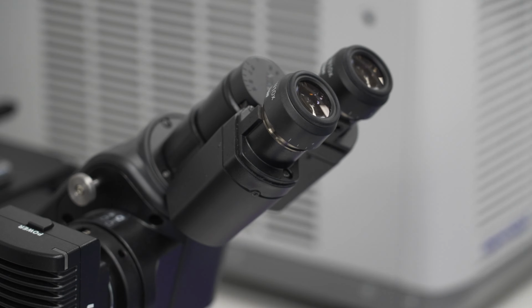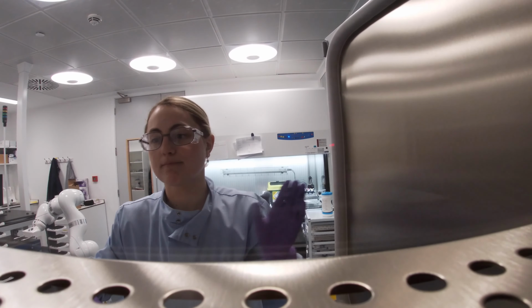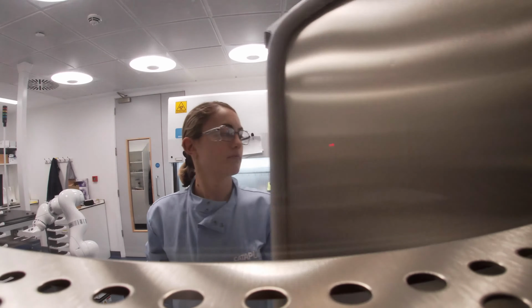One technology we use is genetically encoded calcium indicators. We can transfect with a lentivirus encoding a protein that fluoresces when calcium ions bind to it, under the control of the neuron-specific promoter synapsin. This allows us to stably visualize the intracellular calcium concentration of each neuron in our cultures over a timescale of weeks. Once we've transfected in the calcium indicator, we can record 3-minute videos up to once a day using an IncuCyte SX5 to track changes in neuronal activity over time.